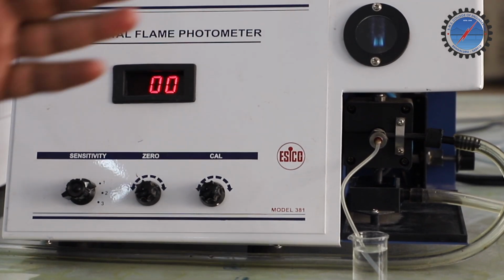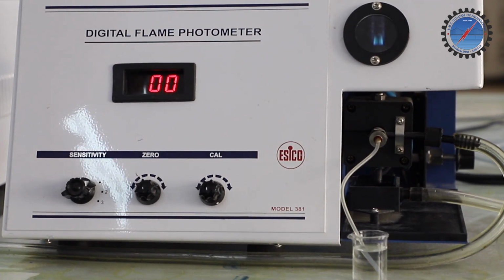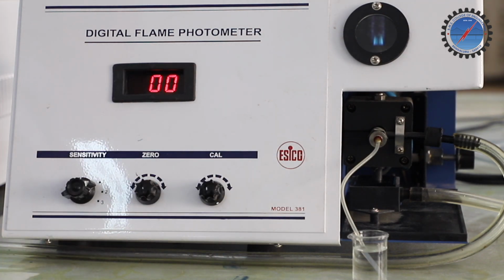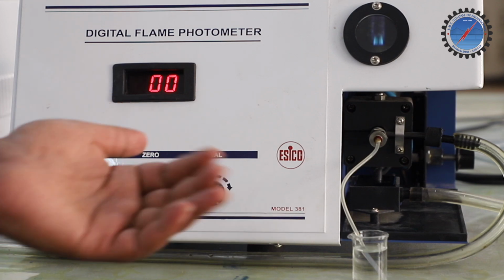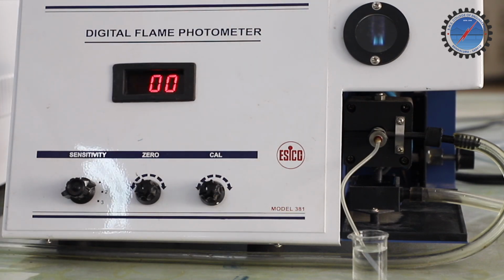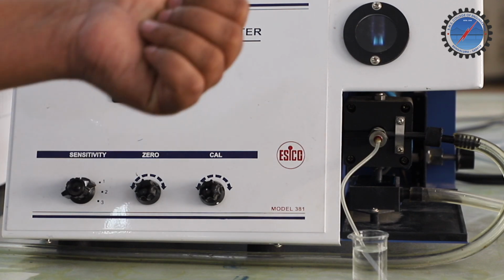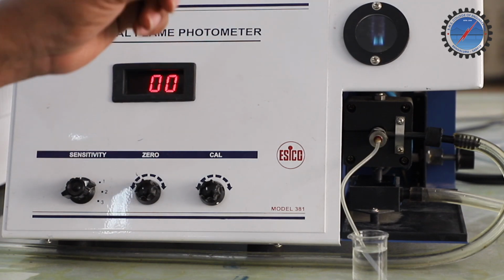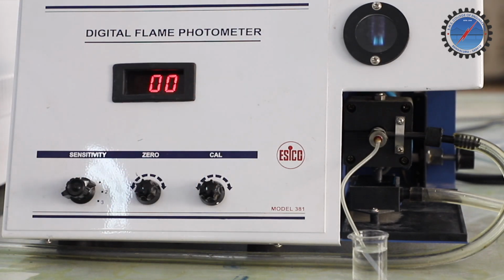This blue color flame is obtained only for distilled water, because distilled water is free from dissolved ions, for example sodium here. So there is no sodium, hence it is not imparting any golden yellow color to the flame. That's why we are observing the characteristic color of that flame. So we will observe a blue flame for this distilled water.